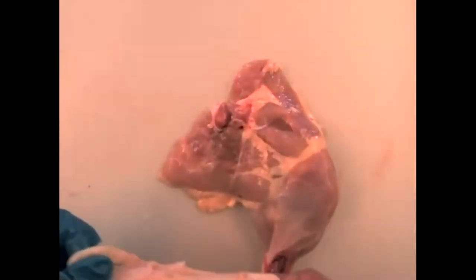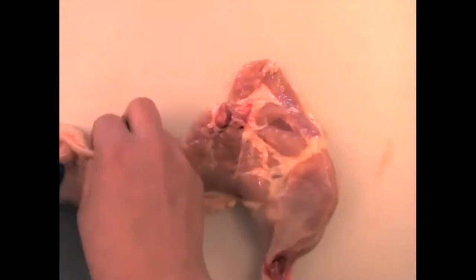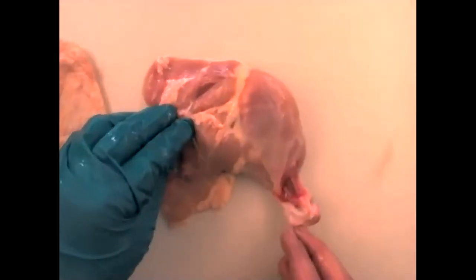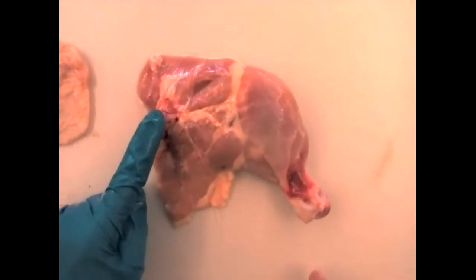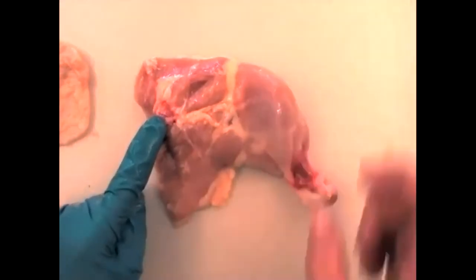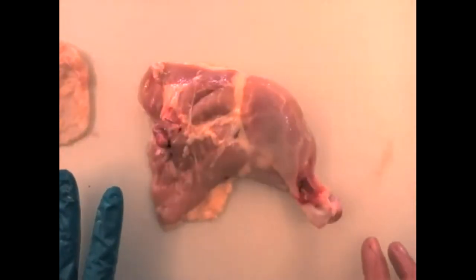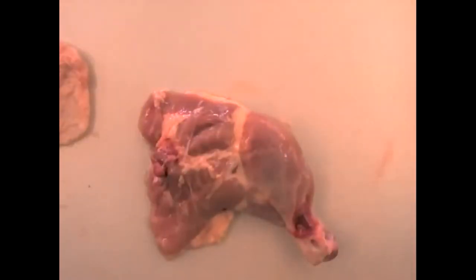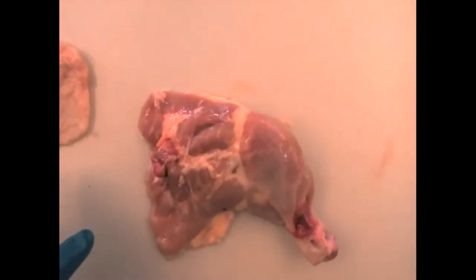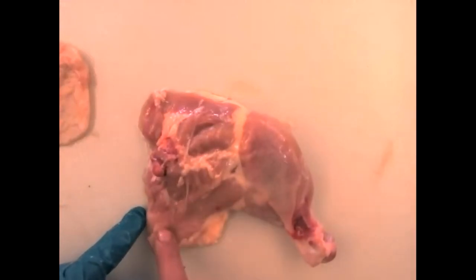That is the skin. You can show me the skin on the chicken leg, or you can show me the skin already removed. Now what we're seeing is the medial side of the leg with the head of the femur here, the ankle down there, and the knee in between. Remember that on the front of your thighs are your quadriceps, and on the back are the hamstrings — exactly the same in the chicken.